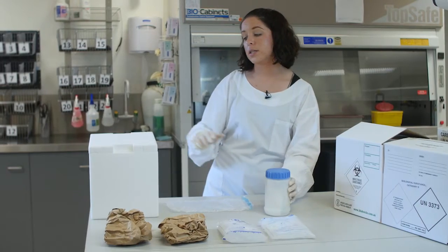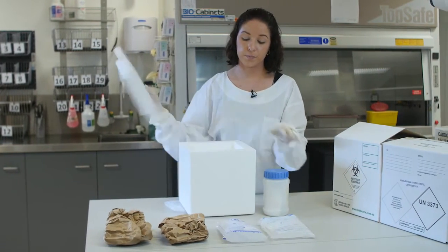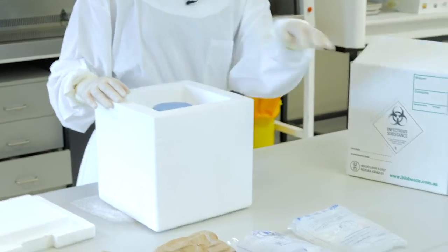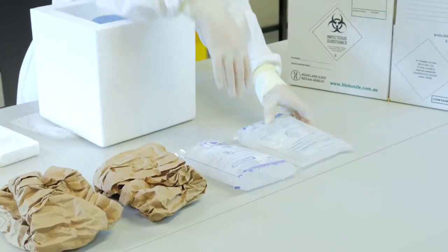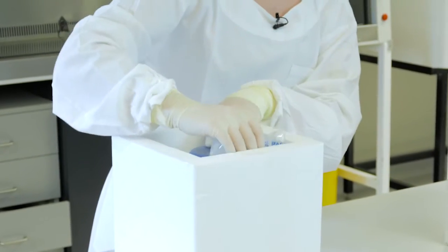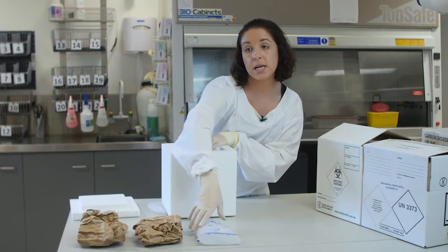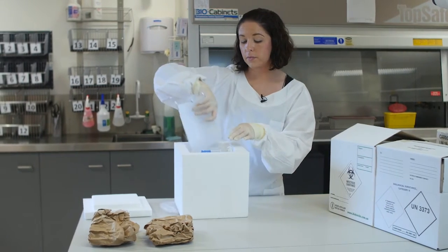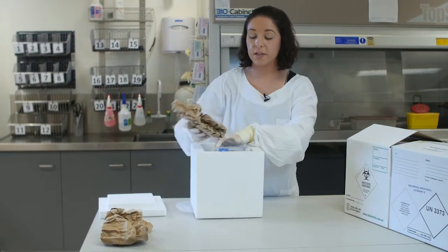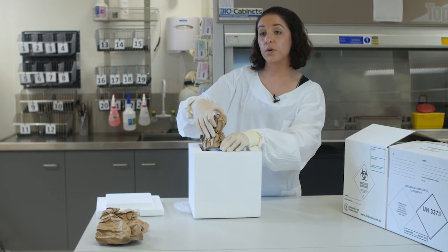Your secondary receptacle is placed into your styrofoam box. You'll also include an ice brick or two. This will ensure that the integrity of the samples are maintained at four degrees. You'll also need to include sufficient packing material to prevent the secondary parcel from moving around.